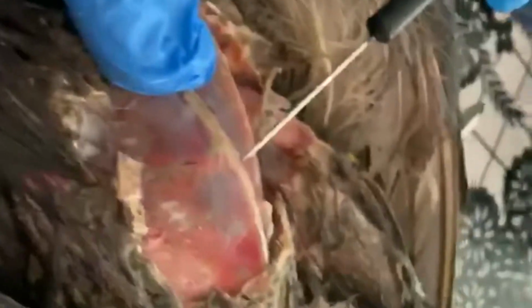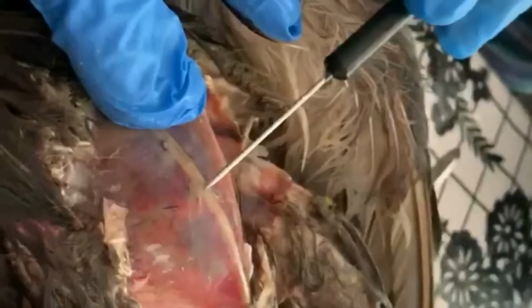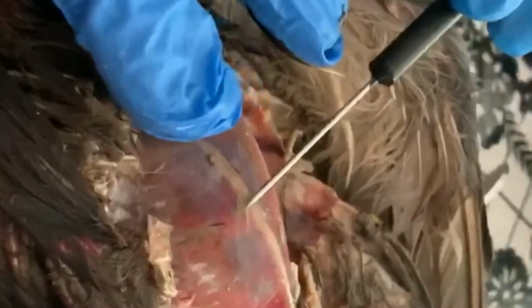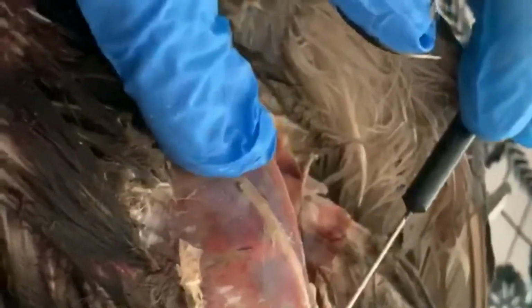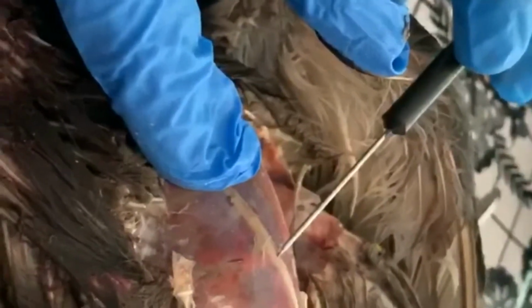All right, so there are a few things we want to point out before we get too far actually into the bird. First of all, we've taken the skin away, but we were careful here not to cut through the bones. This right here, this is called the keel. This is similar to our sternum, our breastbone, but birds, or extant dinosaurs, right, have a much larger bony ridge here, a much larger keel, because this is where all of their flight muscles attach.